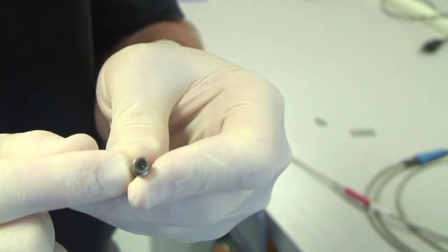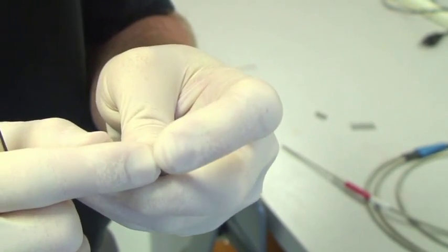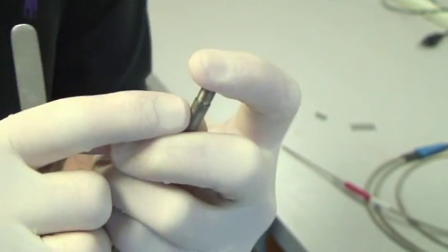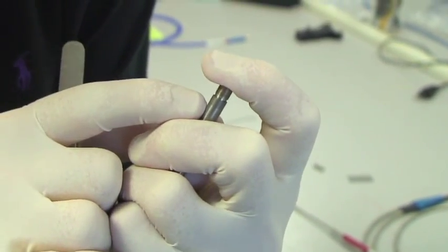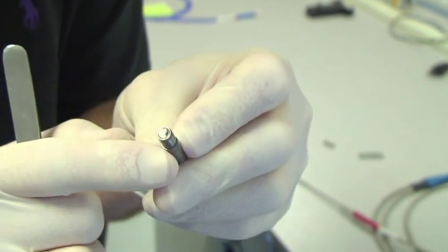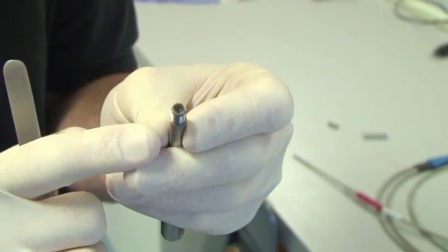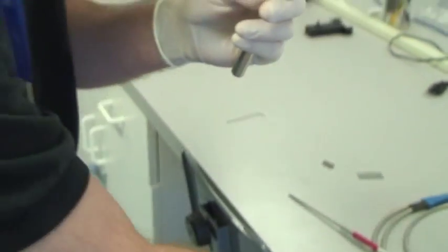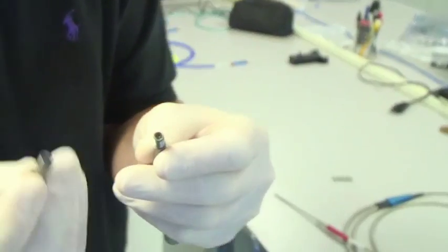There we are. So you can see that's been stuck to the tip, and if you just firmly press against it like this, it's adhered on there and it'll stick on there.